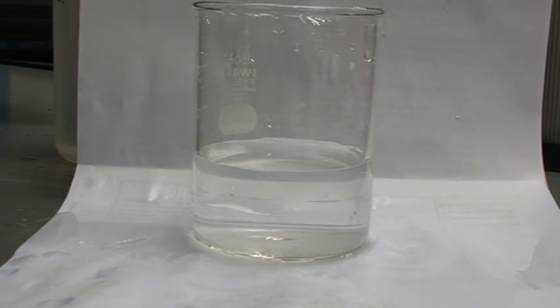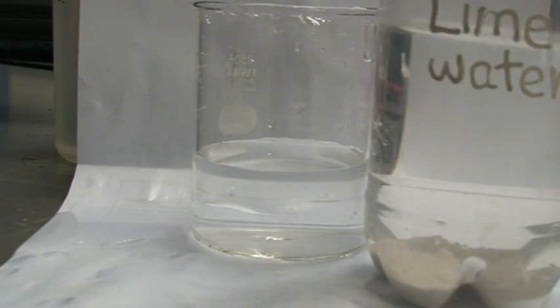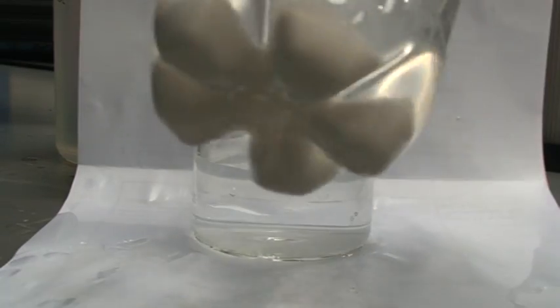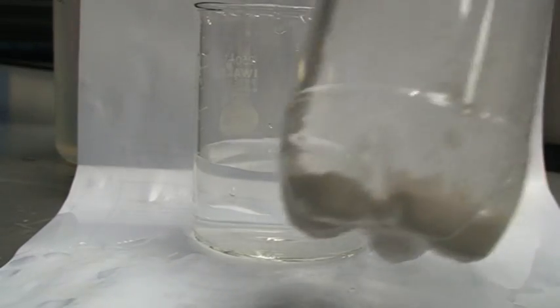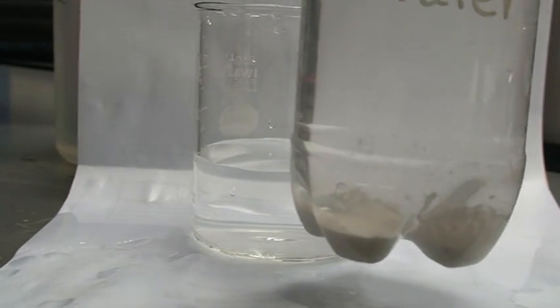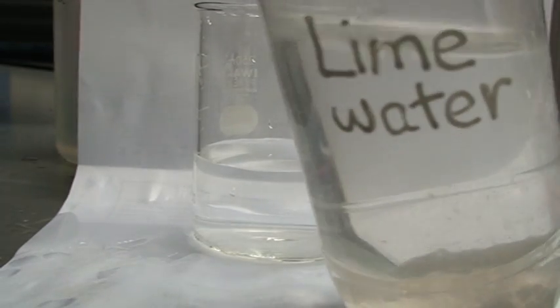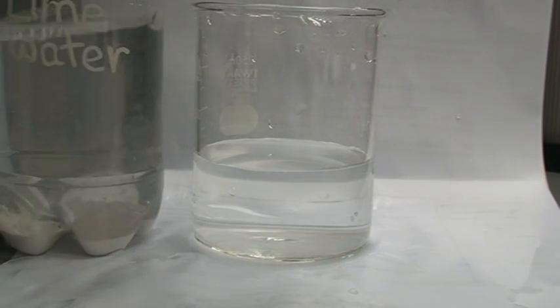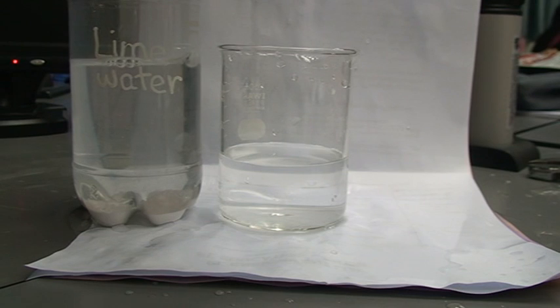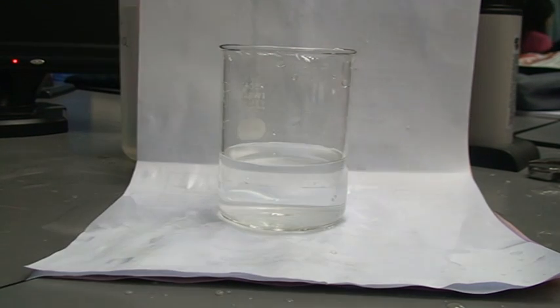Alright, this is saturated lime water. How do I know it's saturated? This is because there are some solid inside here. Can you see the solid? This is solid calcium hydroxide. And I just pour the lime water out there like this. So this is saturated lime water.